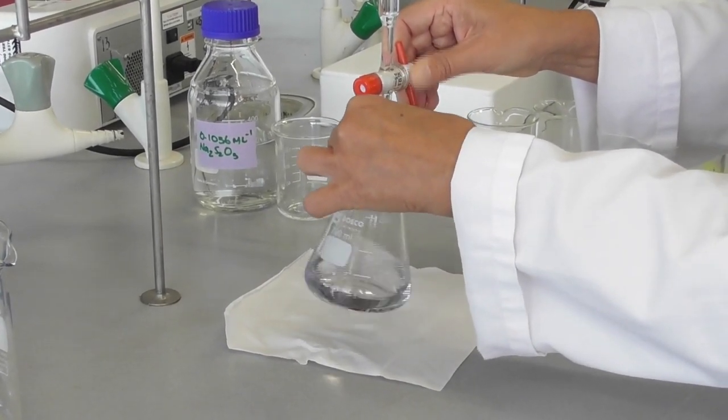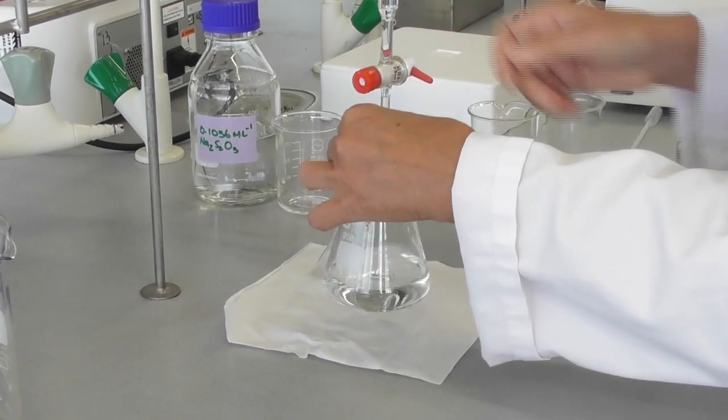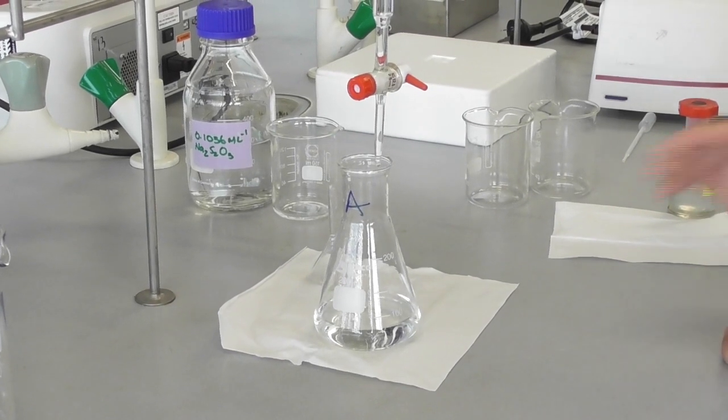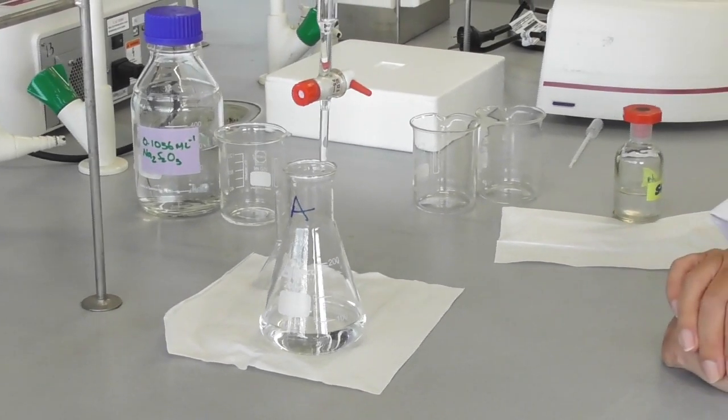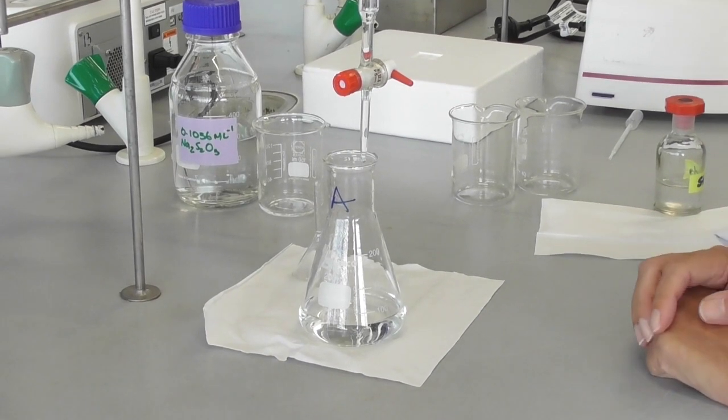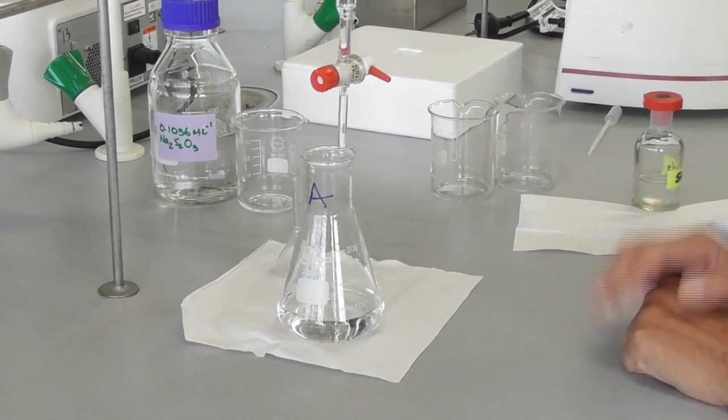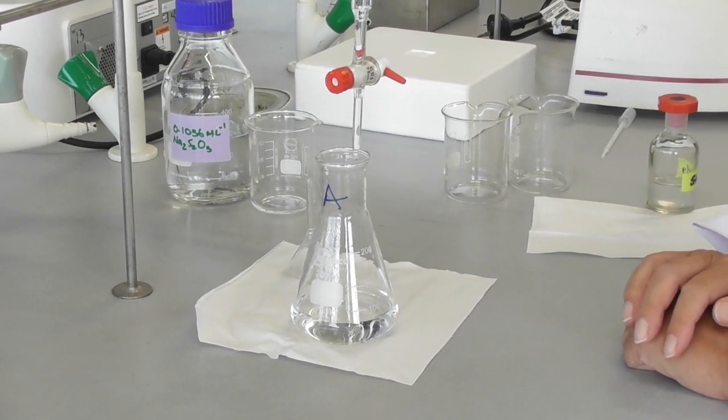My end point will be reached when the solution turns colorless for the first time. So this is the end point. If I let this sit it will turn dark again after a while, but the end point is the first time it turns colorless.